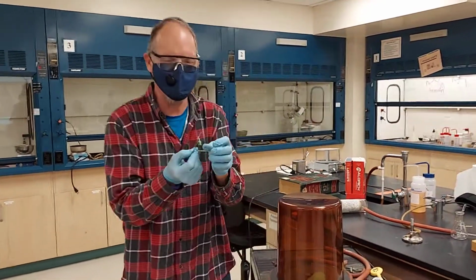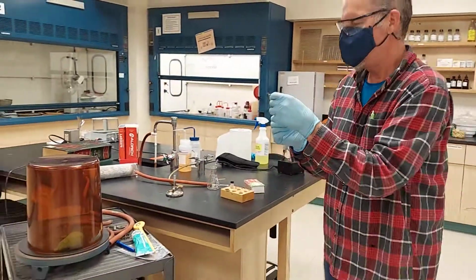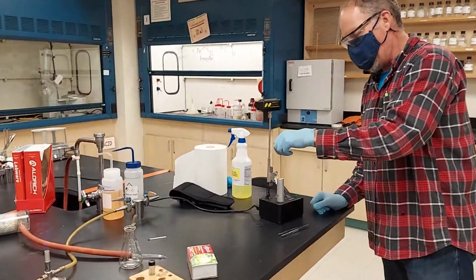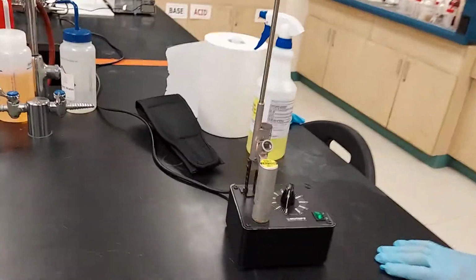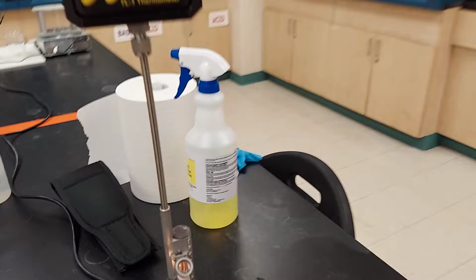It looks straight enough. I'm worried that it's too big up here to fit in the machine, but this would be the beginning of the melting point experiment right now. And we're going to put it in the machine, and that would be the end of the video. It didn't fall to the bottom after all, but you can see if I did a little better job that it would have worked a little better.